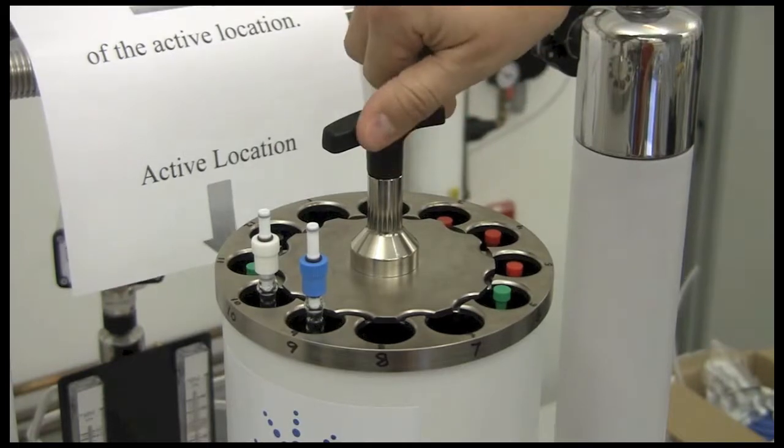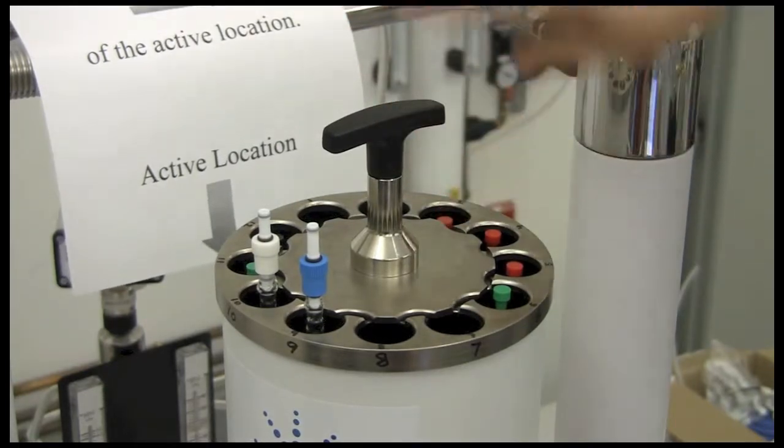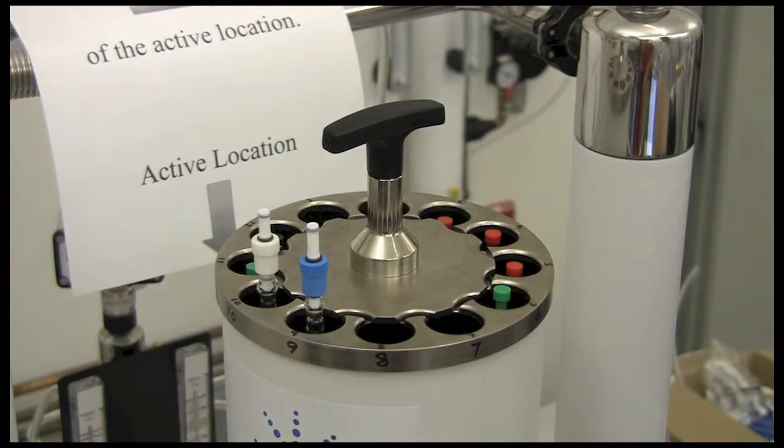If you fail to put it back in the capture position, the sample may pop out or it may bounce, and it will stop the automation run for everyone.